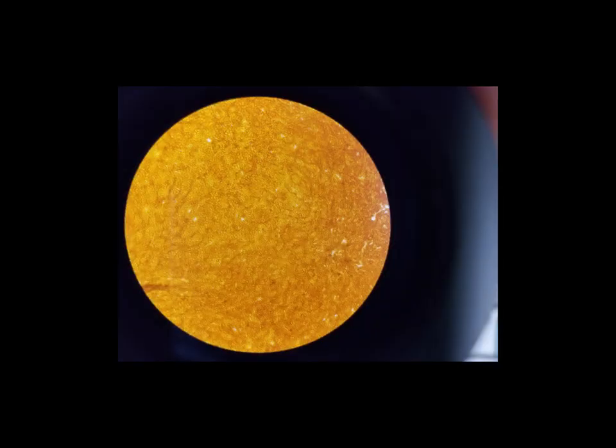Here we have reticular connective tissue. And reticular connective tissue is kind of like scaffolding. If you've ever watched a large building being built and they put up the girders that support everything in the building, that's kind of like the job of reticular connective tissue. And we find it in places where there needs to be some sort of support, like in your bone marrow or in your lymph nodes or in your spleen. And it acts as a framework for the very soft inside of those locations.